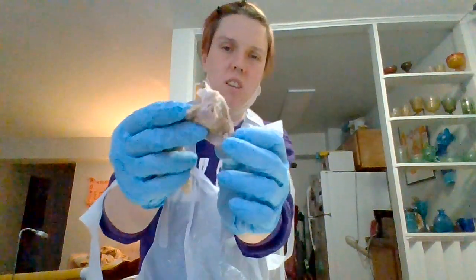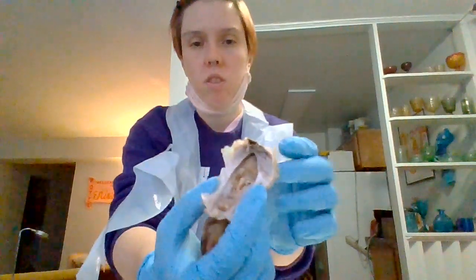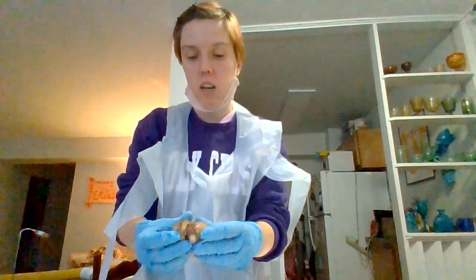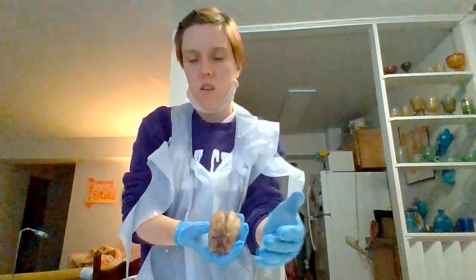It still has the membrane on it. I was having a really hard time getting the membrane off, but we are all in there. That's where we have the cerebellum too, is stuck in there. Sorry, cerebellum. So that's our medulla oblongata. Then we have the cerebral cortex. The cerebral cortex is the outermost layer over the whole brain. So hopefully I'm showing you where all of the gyri and sulci are on the cerebral cortex, as far as I understand it.